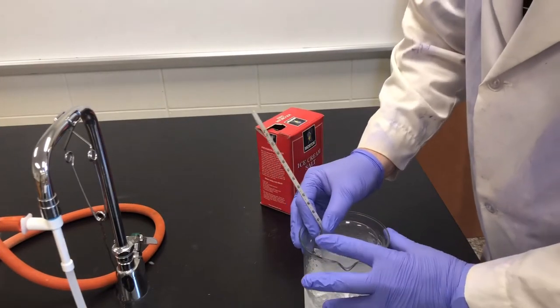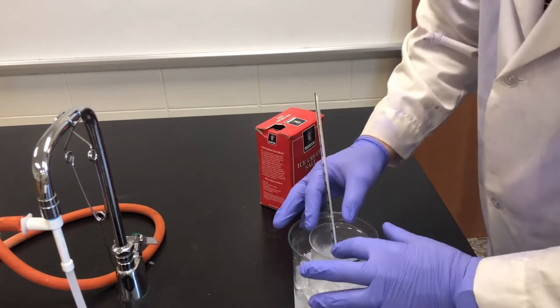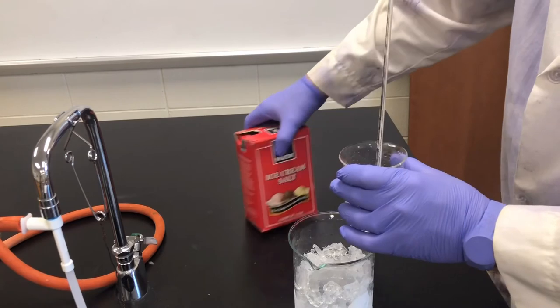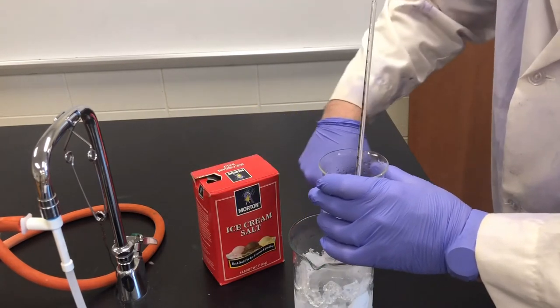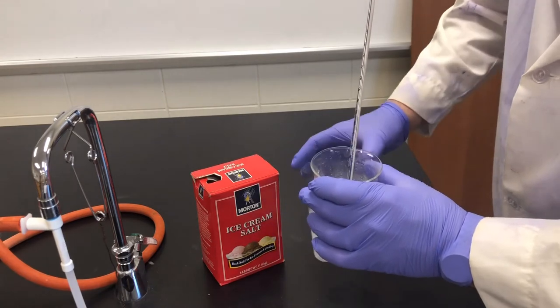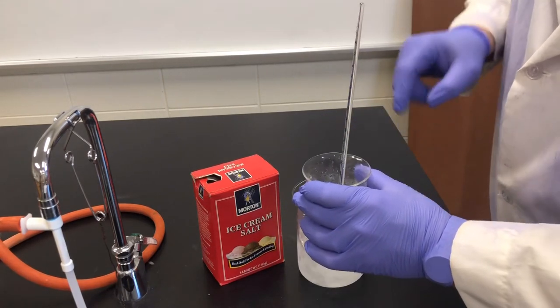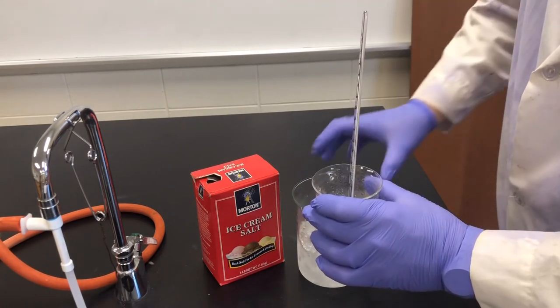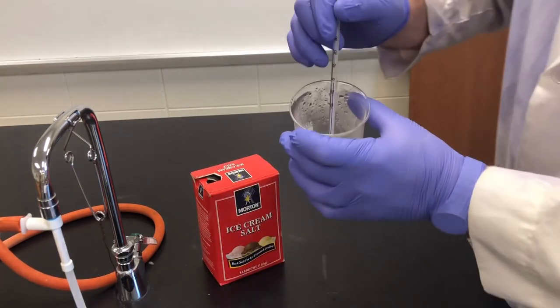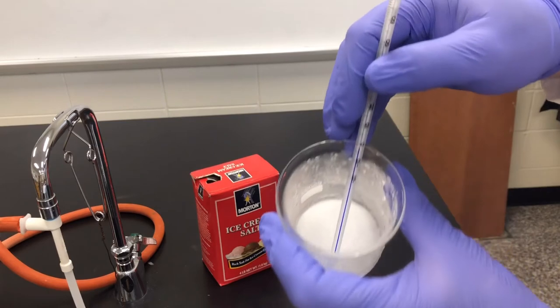Now we have a crystallized form. I'm not going to lie to you, I took ice cream salt, put it around the outside with the ice, making sure I did not get any salt inside of this. That was very tedious. What we have here, once it got down to about six degrees, we got this nice crystal.